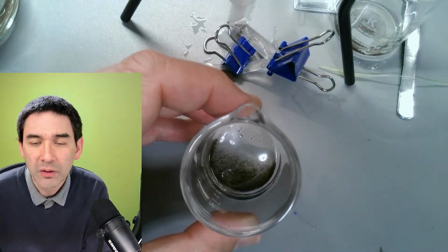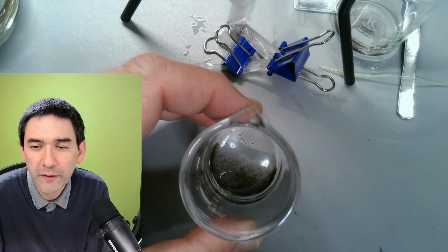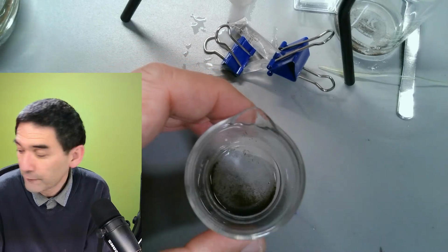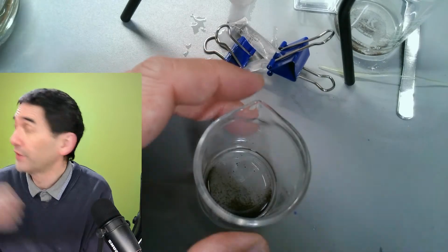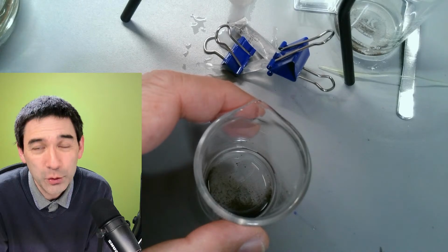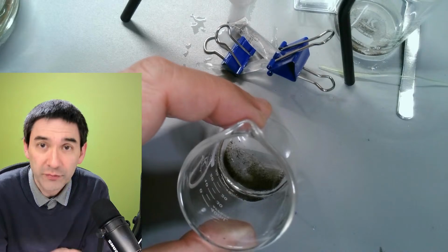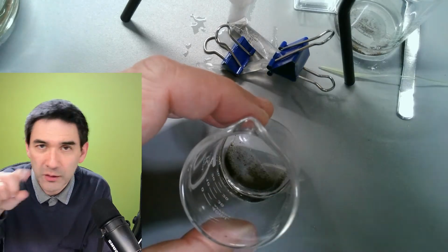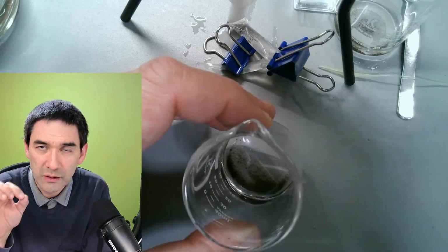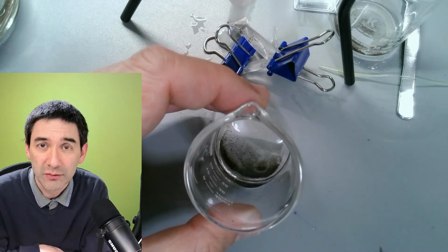So I'm just reading again here. Could you use kitchen or filter paper? Not filter paper, because I think filter paper, like for example from a coffee filter, which I've also got there, is definitely too fine meshed, and it's probably going to hold back too many things, right? So that's actually one of the reasons why I've been experimenting with this suction device here with a pipette, in order to separate the organisms from whatever particles might be in there, right?